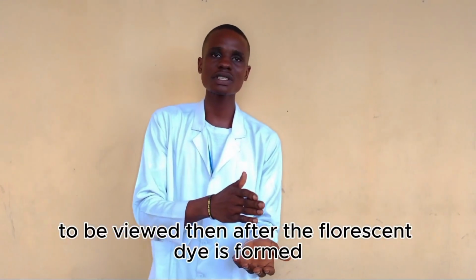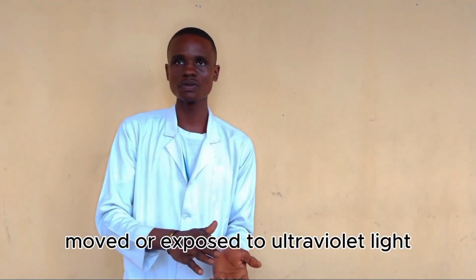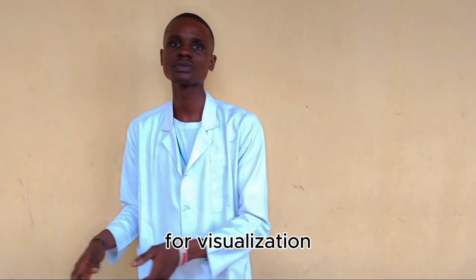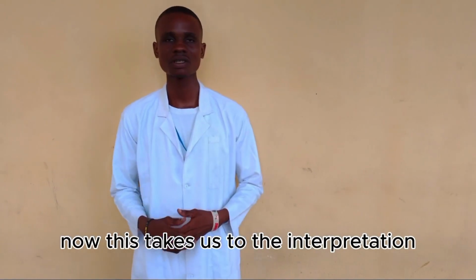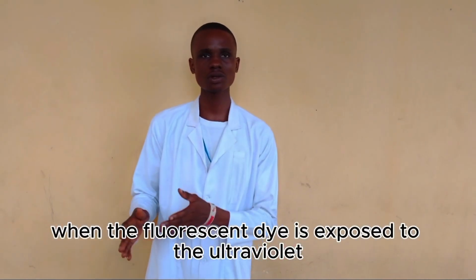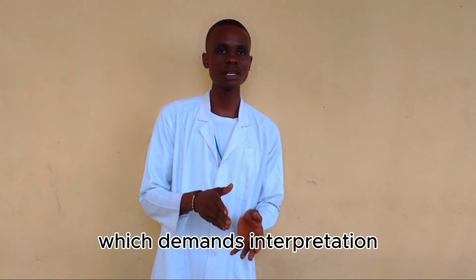Then, after the fluorescent dye is formed, it will be exposed to ultraviolet light for visualization, documentation, quantification, and interpretation. Now, this takes us to the interpretation. So, when the fluorescent dye is exposed to the ultraviolet light, some observations will take place which demand interpretation.